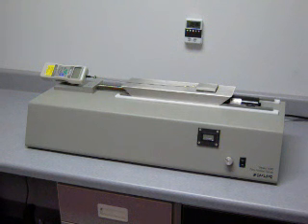Coefficient of friction testing is used in product development or quality control to measure the coefficients of starting and sliding friction of plastic film and sheeting when sliding over itself or other surfaces at specified test conditions. The procedure permits the use of a stationary sled with a moving plane or a moving sled with a stationary plane. Both procedures yield the same coefficients of friction value for a given sample.